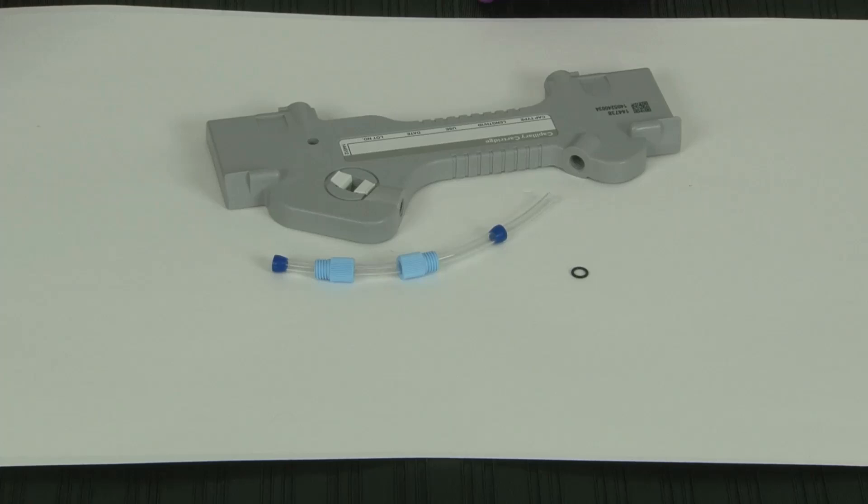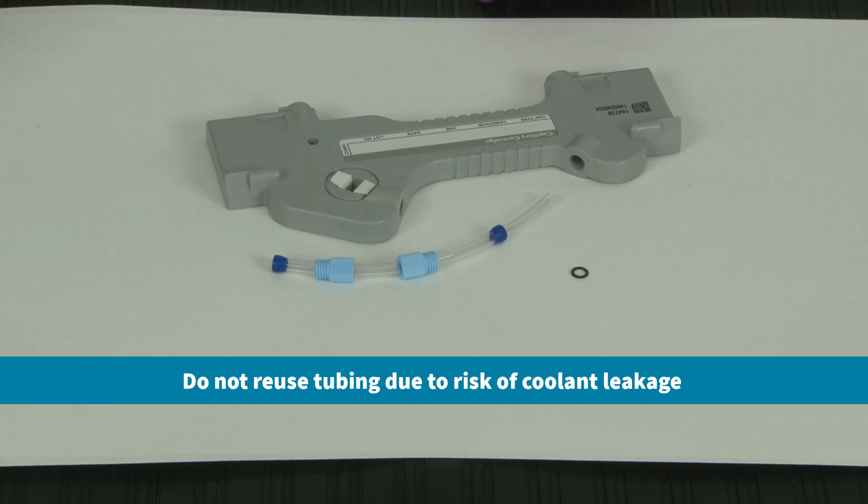Once the tubing has been removed, it should be discarded. Tubing cannot be reused due to the risk of coolant leakage.